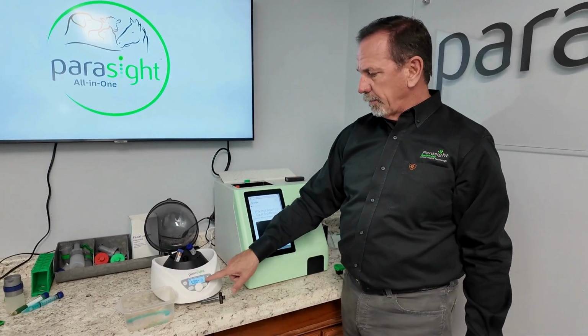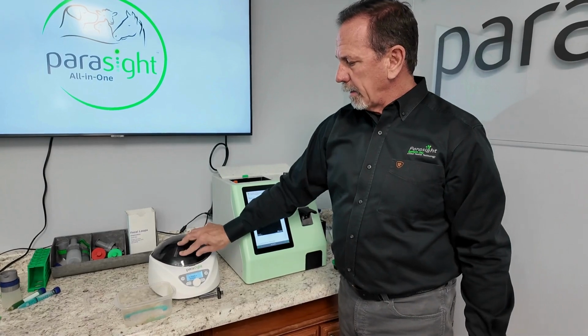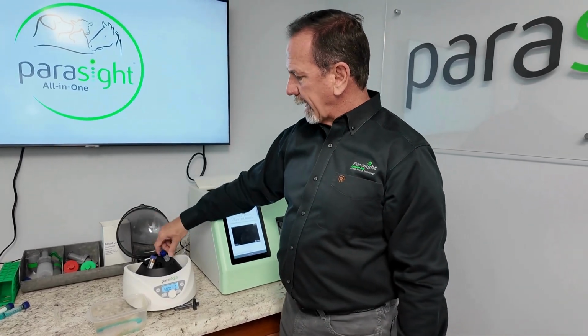So we'll set it for 2 minutes for 5,000 RPM. We'll go ahead and start that. And then after it's done, we'll go ahead and open the door. That will come back out.